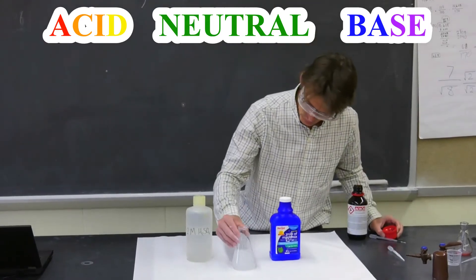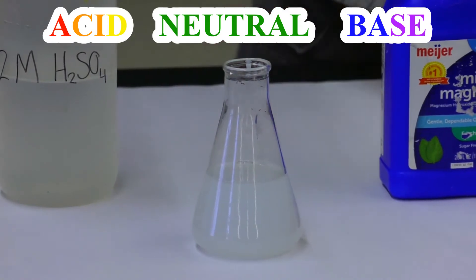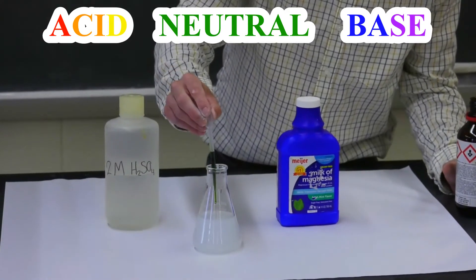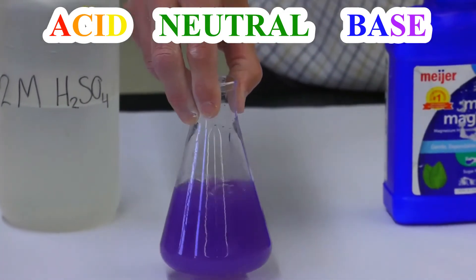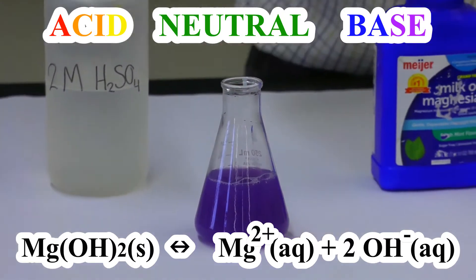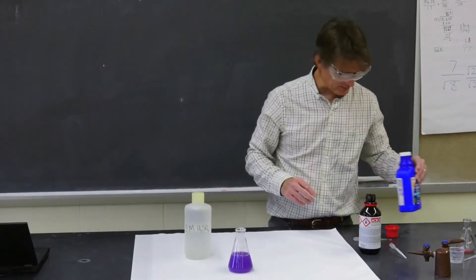So let's see. The only way this will turn blue or violet is if there are free hydroxide ions in there — that's what a base is. So let me add a little bit of this indicator. I claim that magnesium hydroxide, even though it doesn't dissolve real well, a little bit of it does. Let's see if there are free hydroxide ions in there. Oh, look at that beautiful purple and blue! That purple and blue color tells me that even though most of the magnesium hydroxide is undissolved, some of it has dissolved and formed free hydroxide ions that interact with this indicator dye, making it purple. That's very basic — this is a very basic solution.